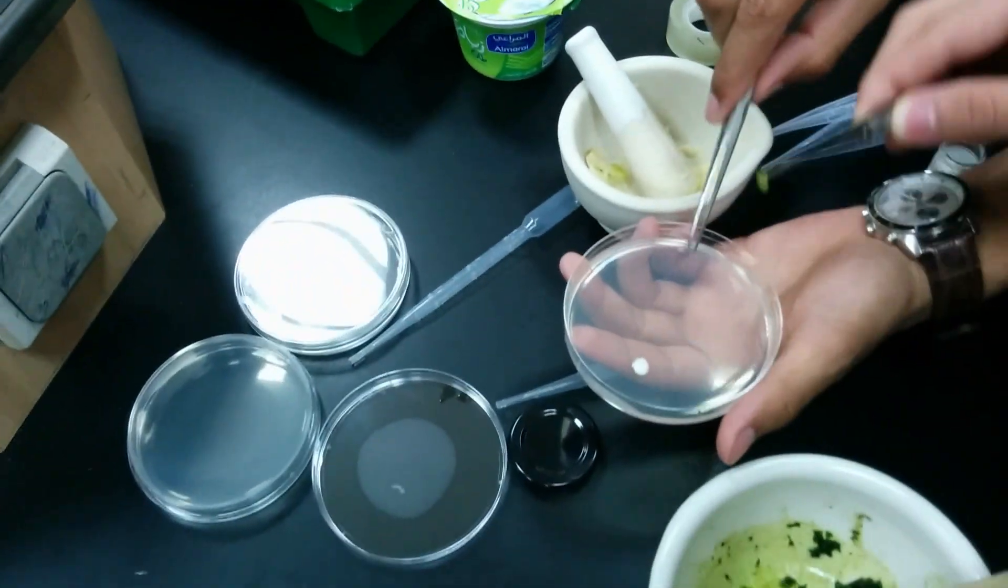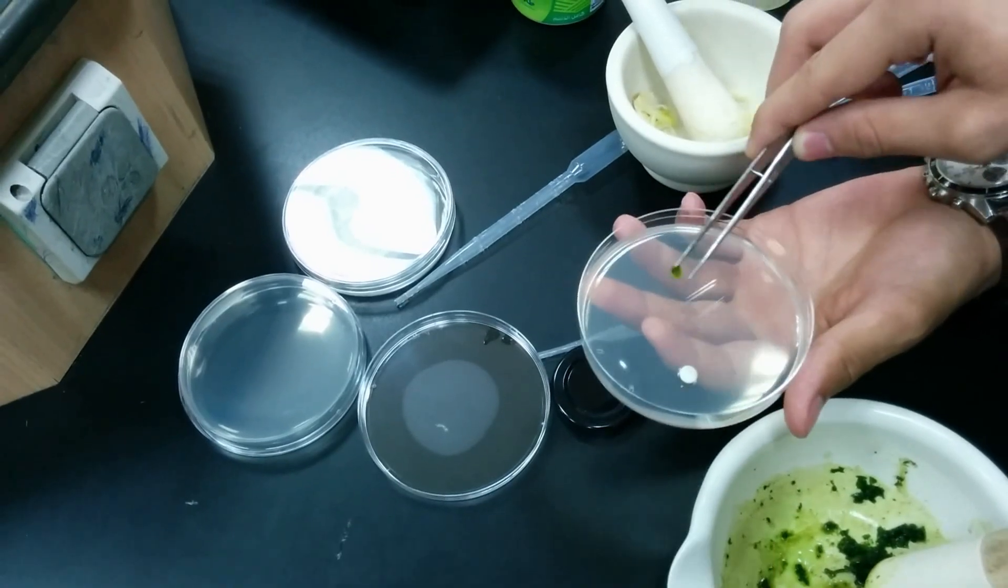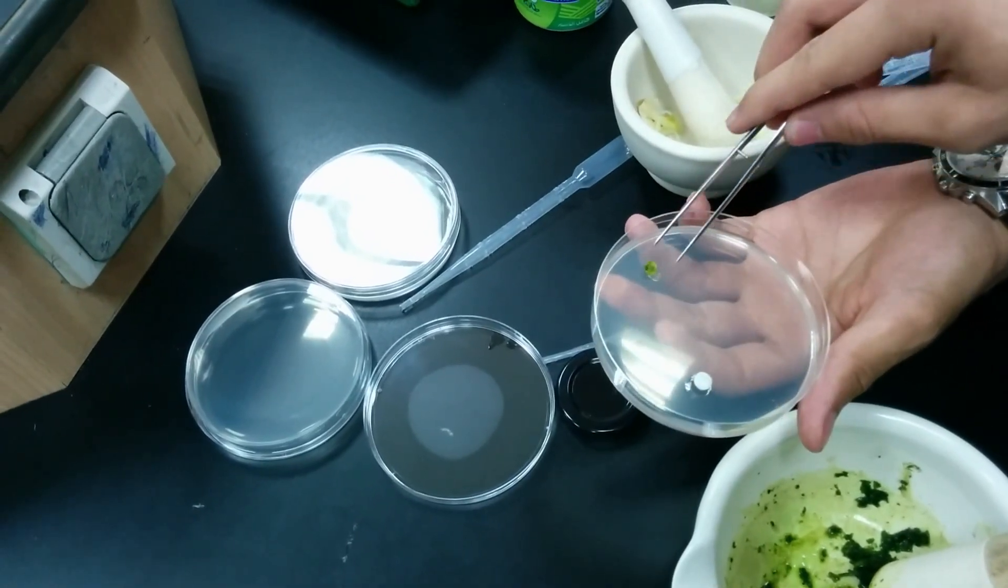Now we place, this is agar medium, we place the paper disks here.